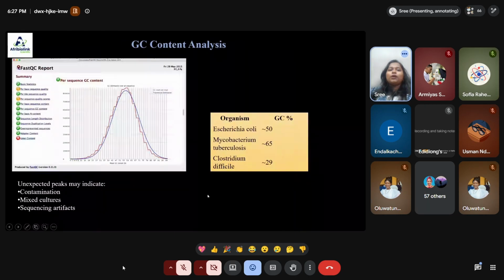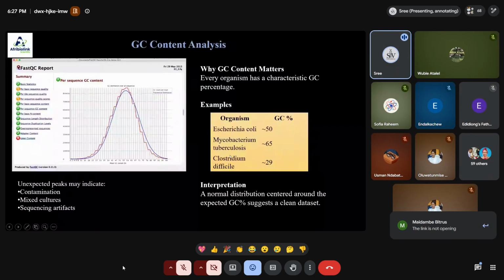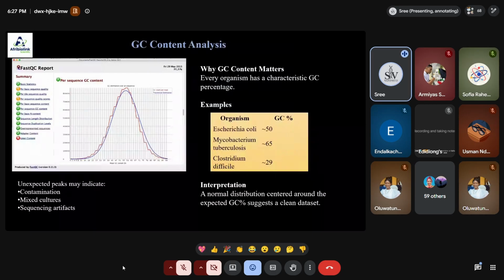Our next thing is called GC content analysis, where we can understand what the percentage of GC content is across the organisms. If it is E. coli, it should be approximately equivalent to 50%. If it is Mycobacterium, it is 65%. It's a standard thing. It can be equivalent; if it is a little below or a little high, it's fine. If it is too low or too high, that might be a deviation, a mixed culture, or sequencing artifacts or all those things. So if it is normal, it should be at the standard percentage it should have.